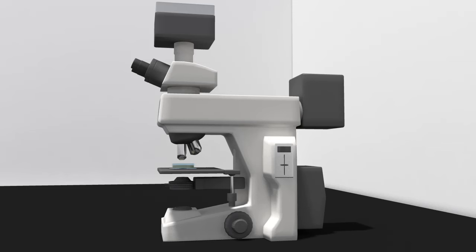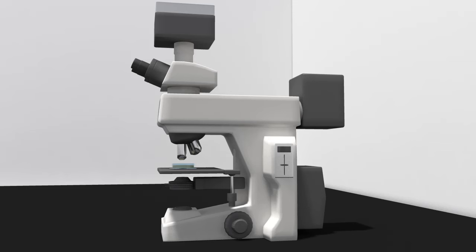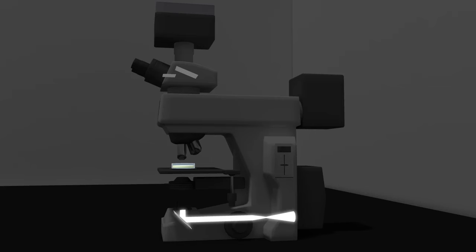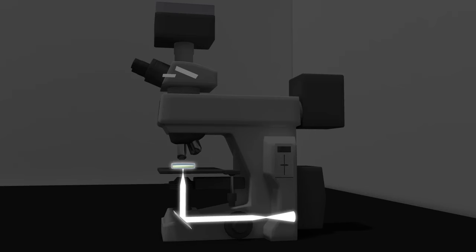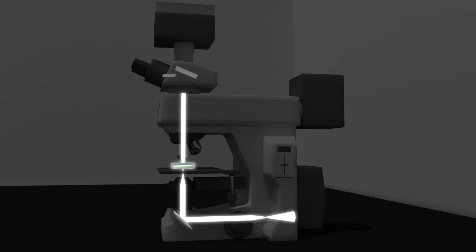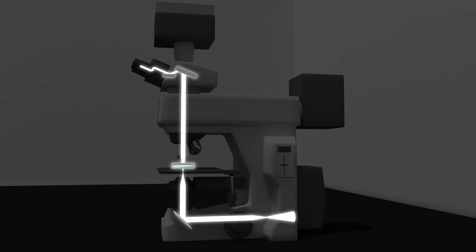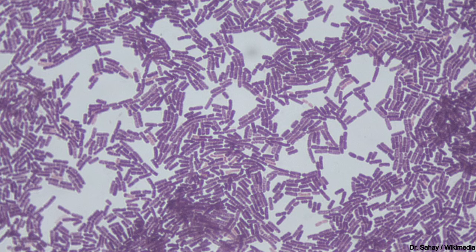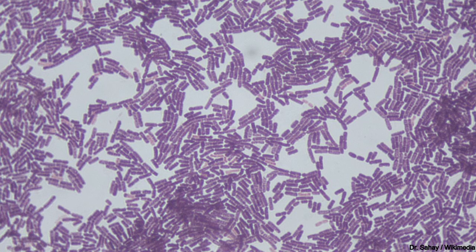In a standard light microscope, the sample is magnified — or appears larger — by transmitting and focusing the light from the light source onto the sample on the stage using the condenser. The image of the sample is then magnified through a series of lenses in the objective and can then be viewed by the eye through the eyepiece.